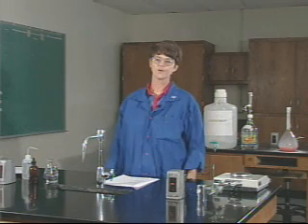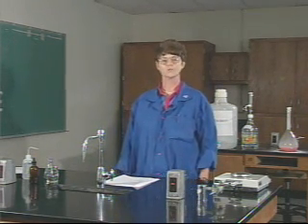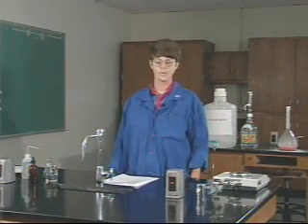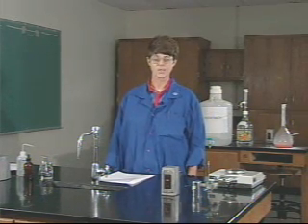This is a very important branch of chemistry, and one of the most important determinations that is frequently made is the amount of acid or base in a given material. There are a lot of techniques that you can use to determine the amount of acid or base, but one of the most common techniques is what's called a titration.